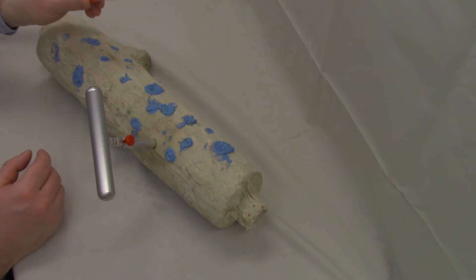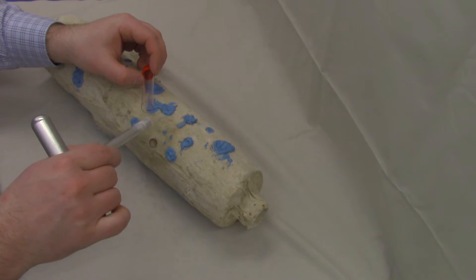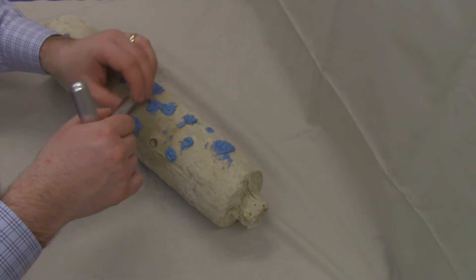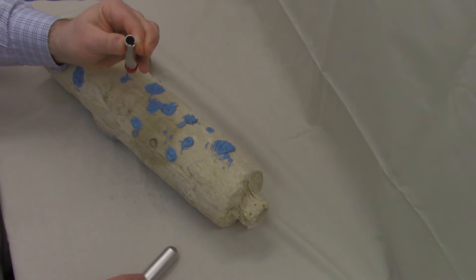And it's now stopped because I've hit the pipe in the center of this pipe wrap. So we've got our sample vial then, we're going to slide this out. See those fibers there? And we're going to slide this into the vial, pinch the top so that we're holding the cutter sleeve tight, undo the thumb screw, pop that off.